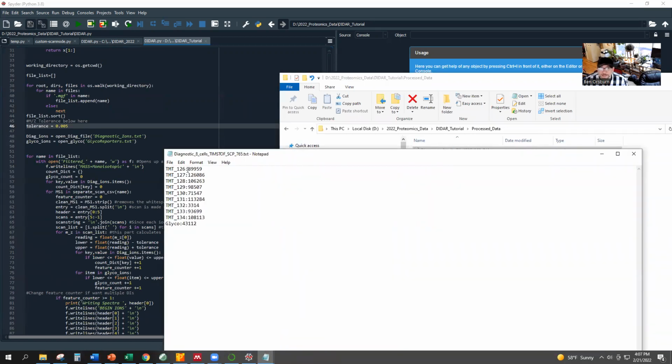Okay, so what we've got here, and this is how lightweight this is, from this file, there were 89,959 MS2 spectra that contain the 126 reporter ion, 126,000 that had the 127. And this is from 8 single cancer cells that were loaded onto timsTOF SCP as an analysis. And 132 was our method blank in this. So there's basically no reporter ion in the 132. It's random shot noise and everything. You're going to see some 132s. I'm still looking at the glycans, and there's a surprising number of glycan reporters, but I gave a pretty large library of diagnostic ions. But in general, we get about 108,000, somewhere between 70 and what's the highest number, 126,000 MS2 spectra that contain reporter ions from these single cells, and that's what I get from data.